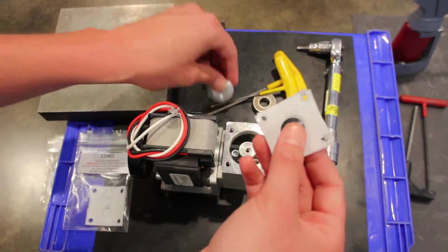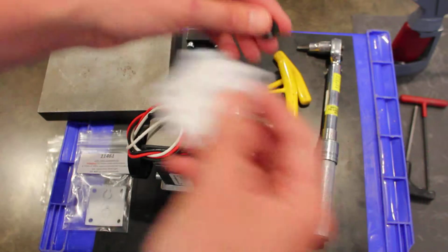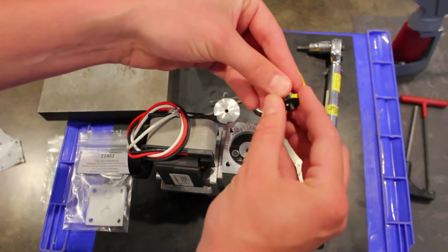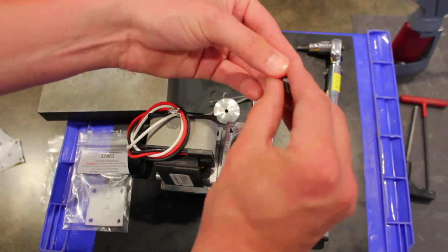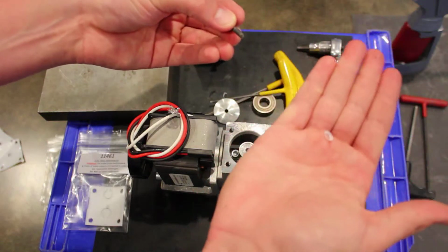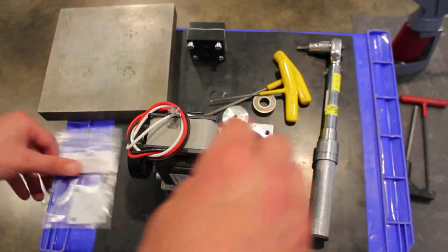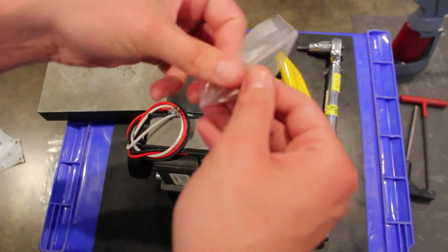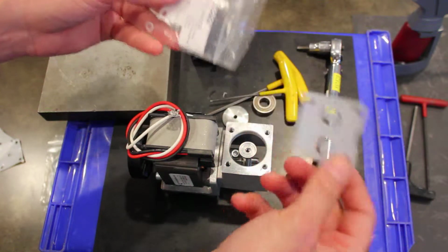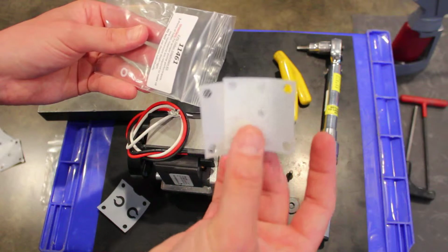We'll take the cap off, and then we will slowly remove the used diaphragm, discard those on the side, and then we'll pull out the diaphragm plate so we can get to this little Teflon washer seal, which we'll pull off the back of the screw and discard. And then we'll go into our kit, which is going to include a valve gasket, a 2-ply all Teflon diaphragm.